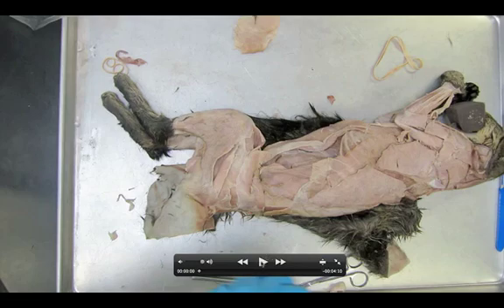Okay, here we go, class. We're going to take a look now at dissection 13, the deep lateral thigh muscles. As a quick review, we should know that right now we left off, we have the biceps femoris — I'm trying to highlight them right about here. This is the biceps femoris. The main goal of this dissection is to cut this muscle in half and fold them open. That's the big goal that we have to do here.